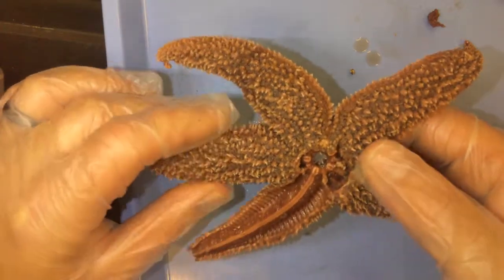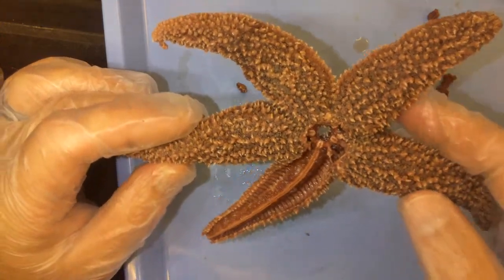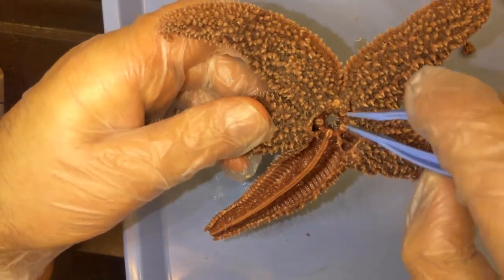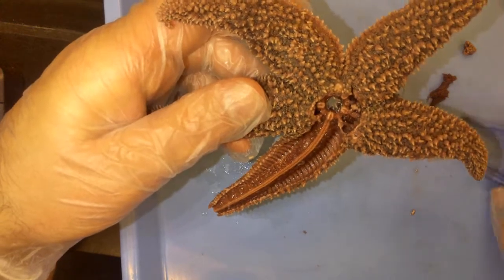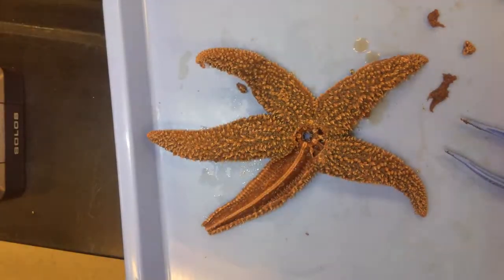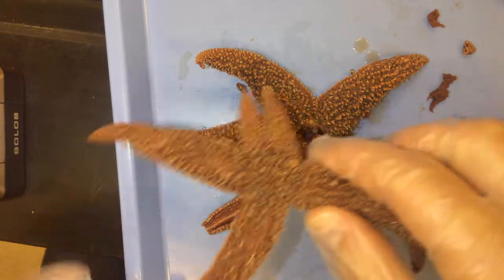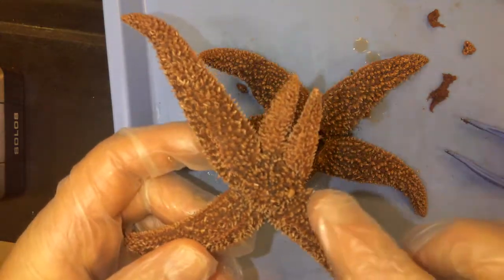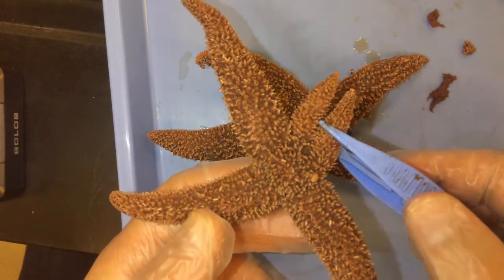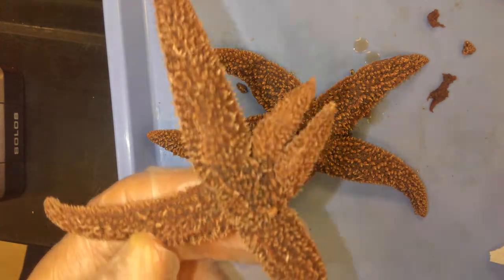That just about does it for the sea star. One other thing I wanted to mention is its ability for asexual reproduction. The sea star is able to regenerate its limbs — in fact, as long as the central disc is intact, it's going to be able to regenerate all of its lost limbs. Here's a sea star that looks like it was in the middle of regenerating these two limbs right here. If you look at them compared to the other limbs, they're much smaller, so it probably lost these two limbs and was able to grow them back through regeneration. This is a type of asexual reproduction.